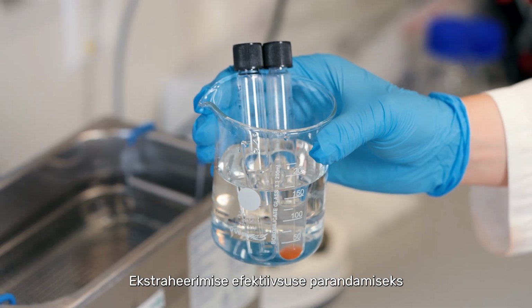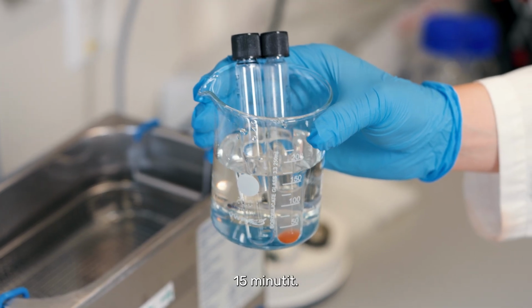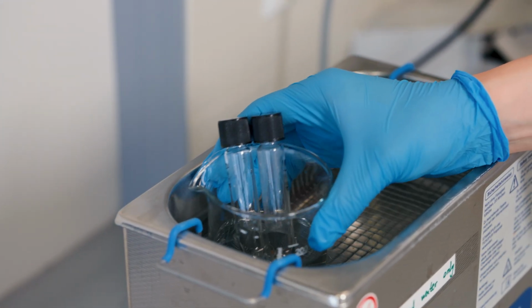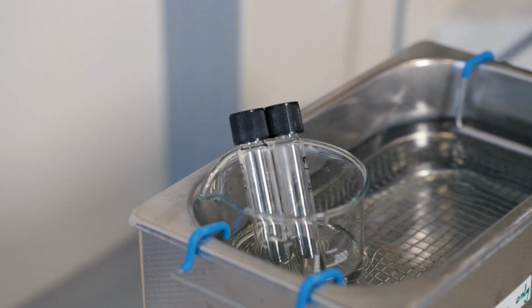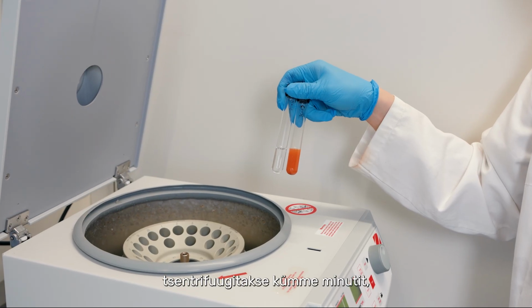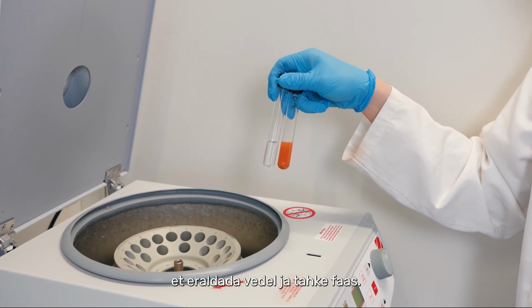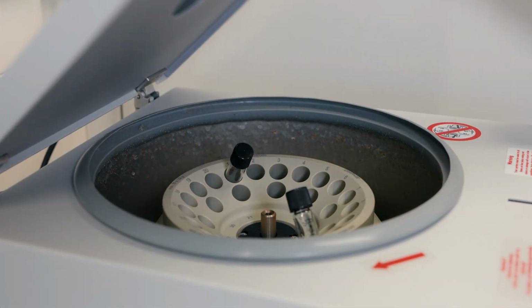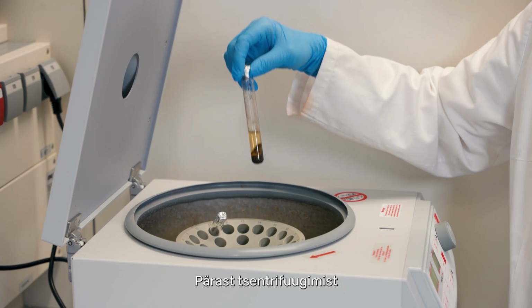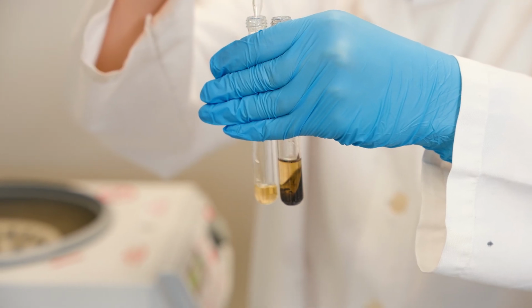To enhance the extraction efficiency, we will use the sonication for 15 minutes. For solvent extraction, the sonicated samples will be centrifuged for 10 minutes to separate the liquid and solid stuff. After centrifuge, we will transfer the liquid part to another tube.